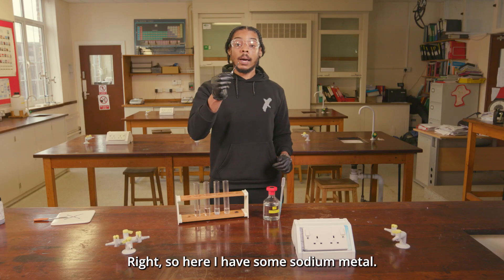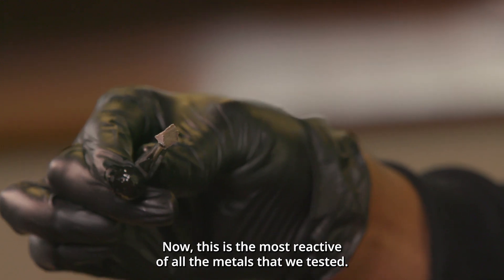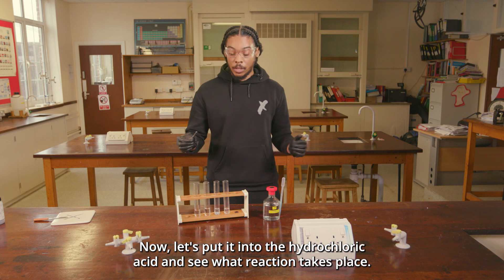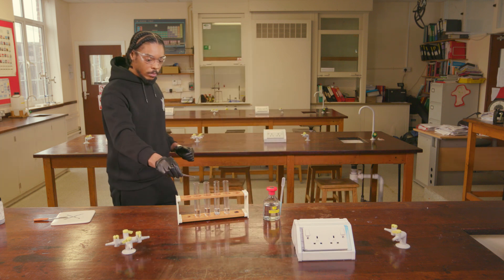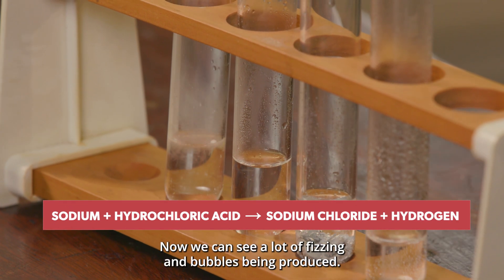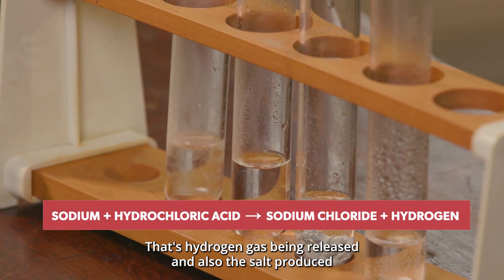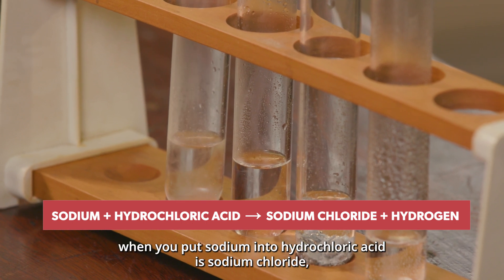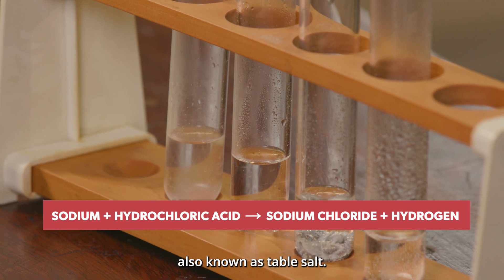Here I have some sodium metal — this is the most reactive out of all the metals we've tested. Let's put it into the hydrochloric acid and see what reaction takes place. We can see a lot of fizzing and bubbles being produced; that's hydrogen gas being released. The salt produced when you put sodium into hydrochloric acid is sodium chloride, also known as table salt.